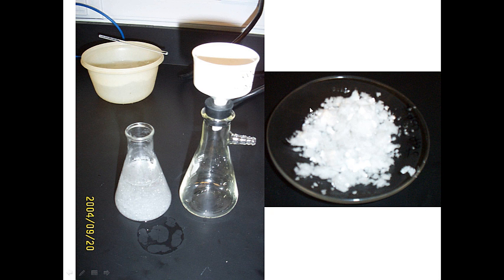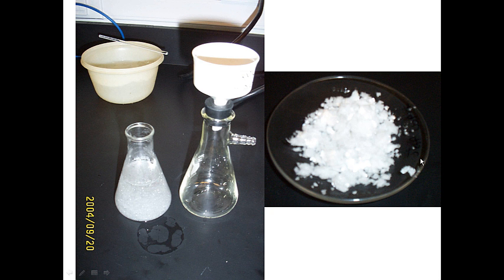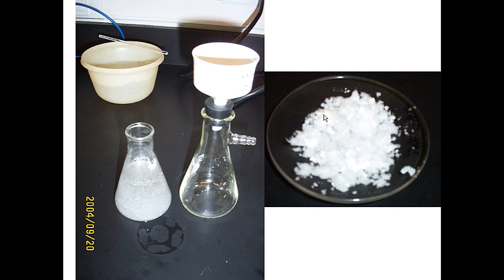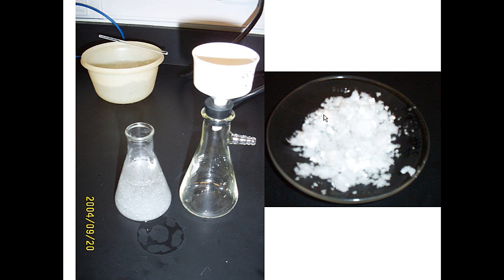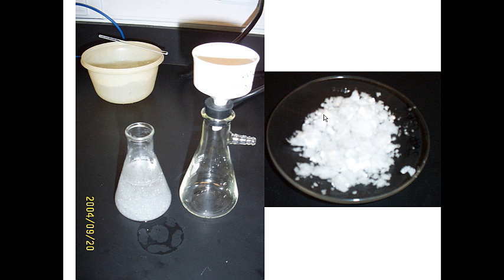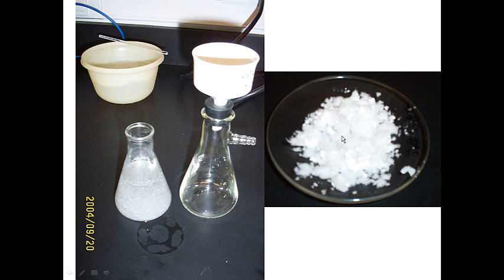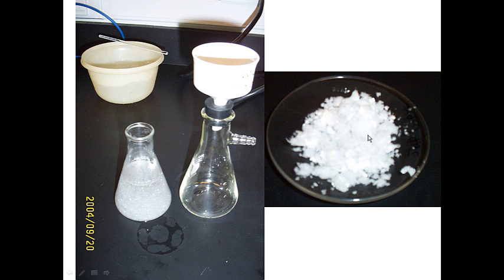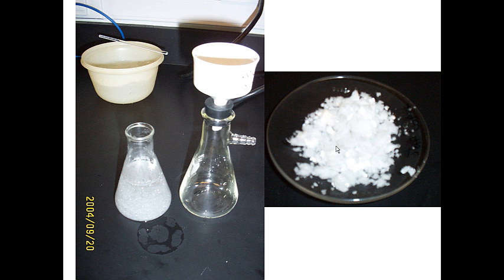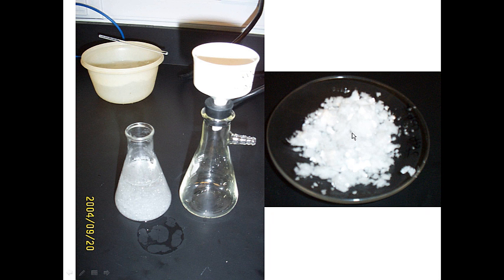Allow air to flow through the crystals for a few minutes, then scrape them onto a watch glass or aluminum dish. Determine the mass of the wet crystals — make sure you recorded the mass of the dish beforehand. Place the dish in the oven for ten to fifteen minutes, then remeasure the mass to determine how much water was lost. If the crystals still look wet or clumpy, dry them a second time. We will then take melting points of both the recrystallized material and the original starting material to compare purity.